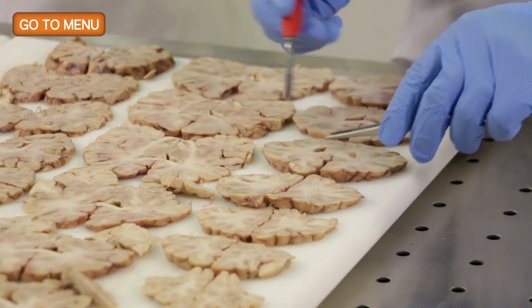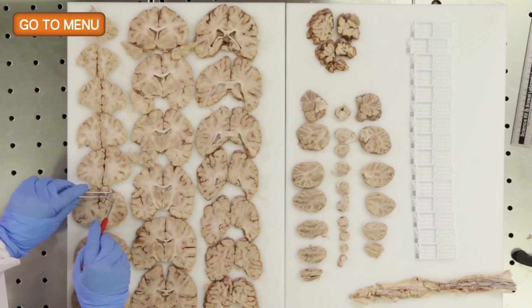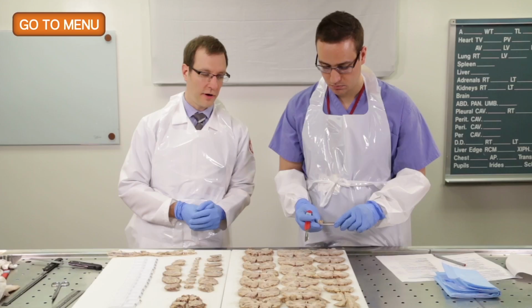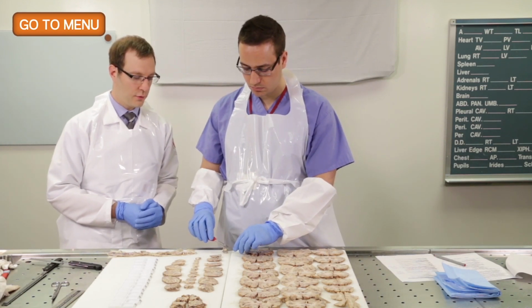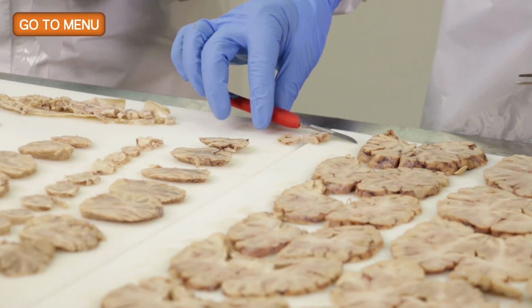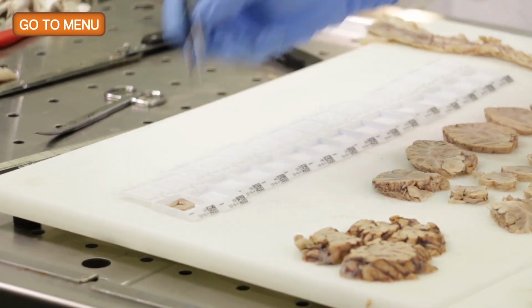So while we're doing this, we want to, again, retain whether or not we're sampling the left or the right half of the brain. And in terms of the routine sections, it helps to just stay with one side or the other, and you can choose which side is preferable to you. That way, if you always do it the same way, it's more routine. Okay, so excellent. So we've sampled the superior frontal cortex in the watershed distribution, and that will go into cassette 1.